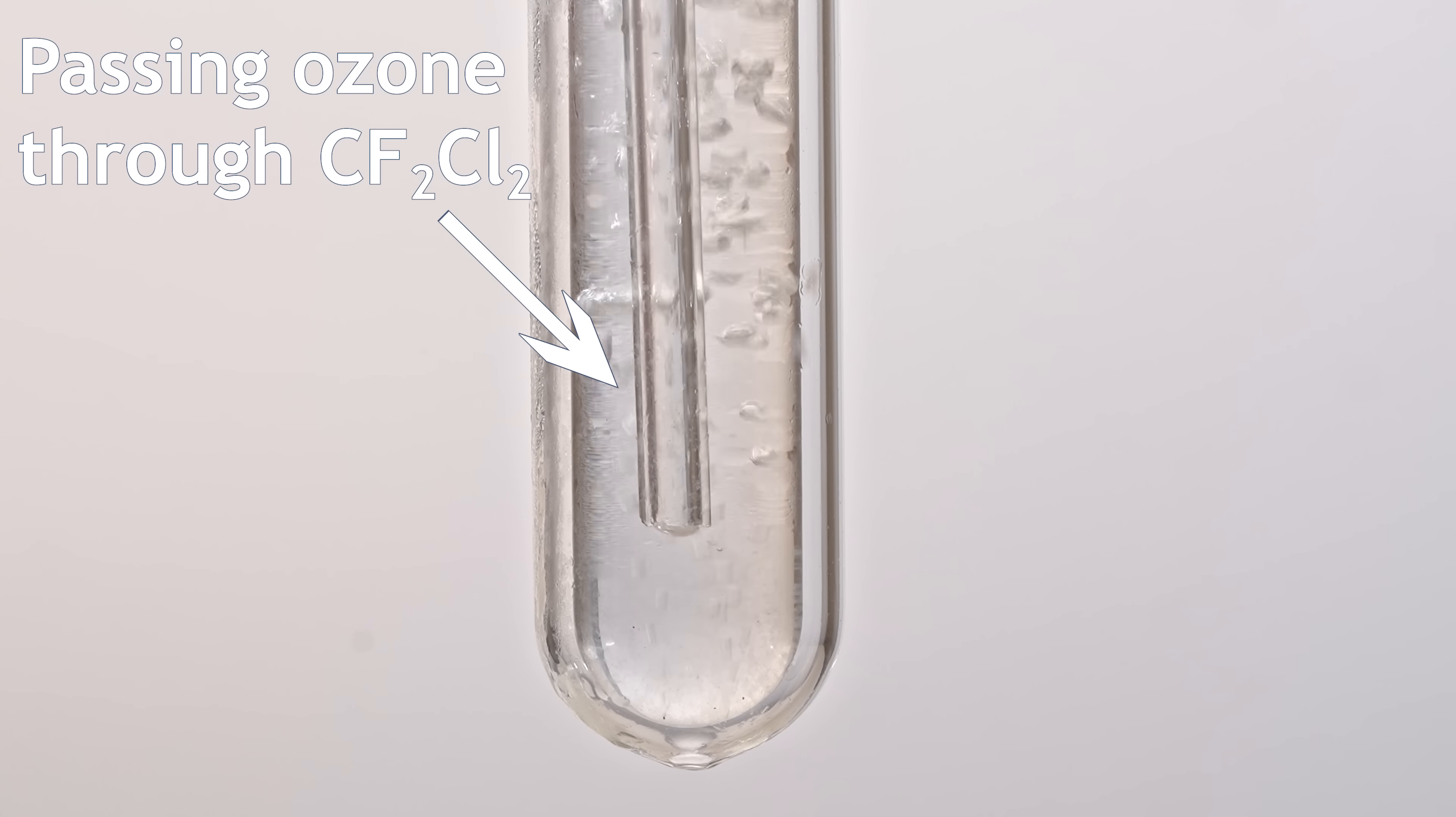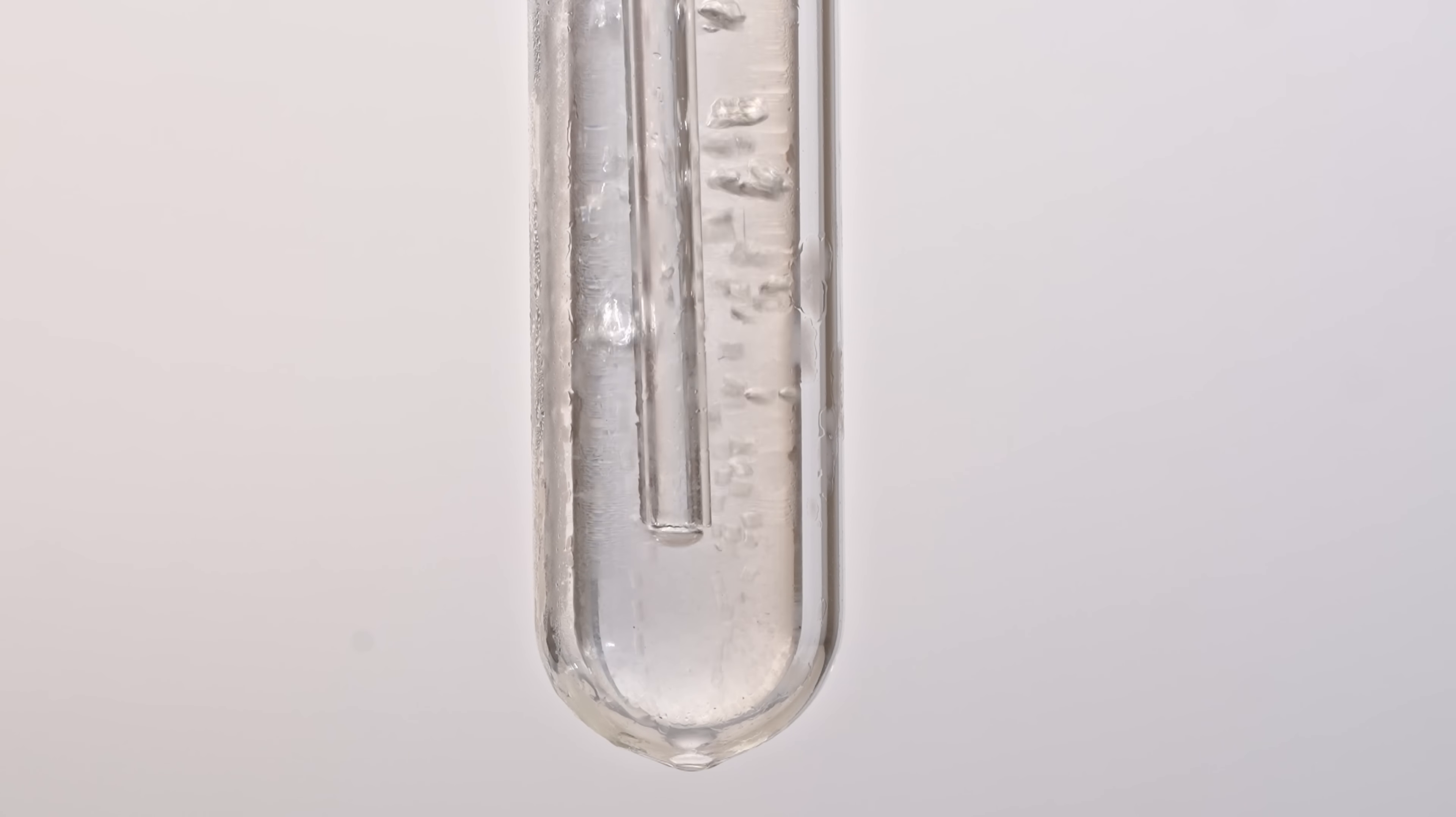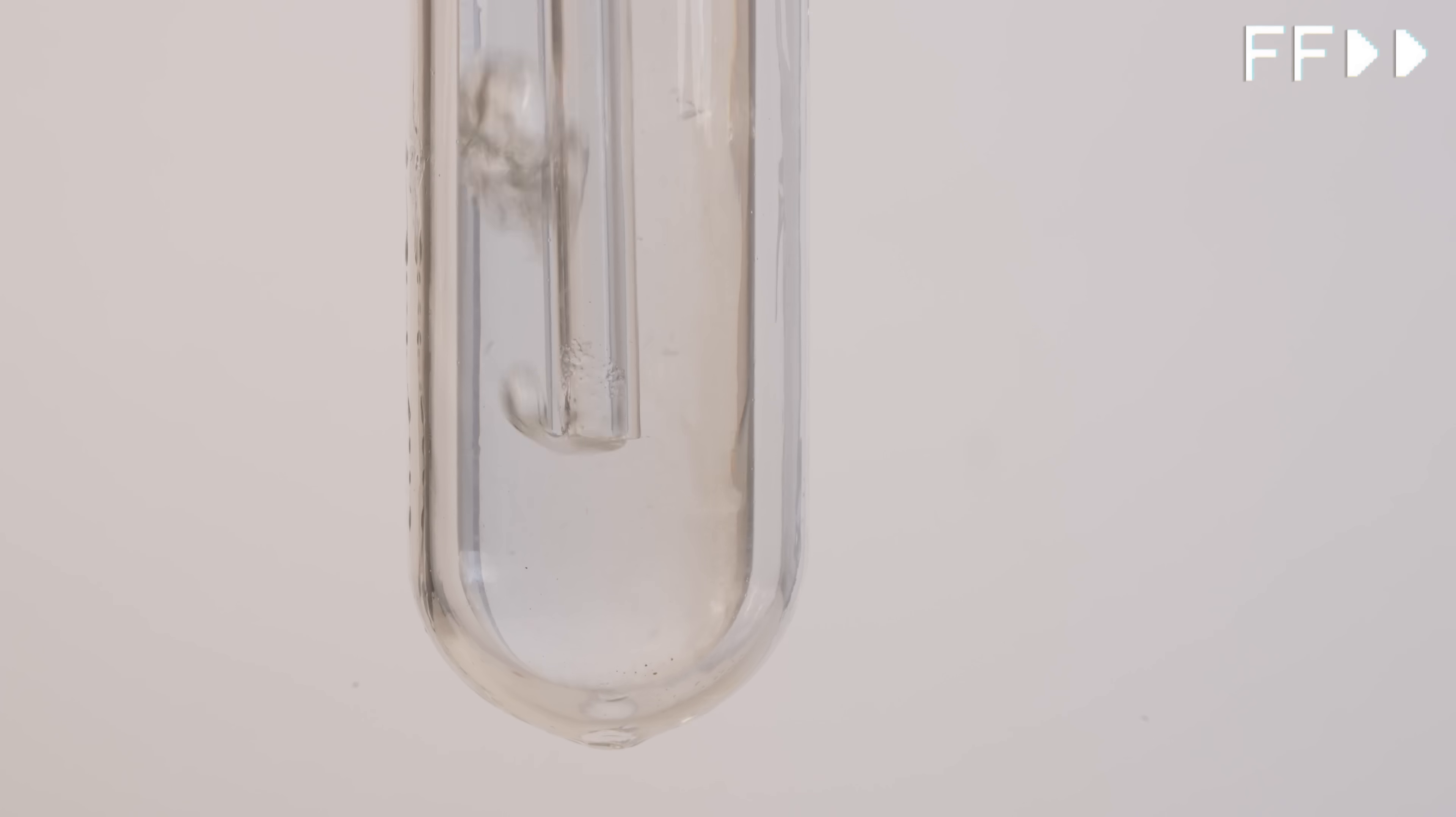When ozone is bubbled through it, the solution gradually turns blue. The intensity of the color depends on the amount of dissolved ozone.